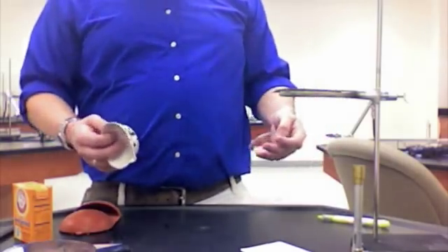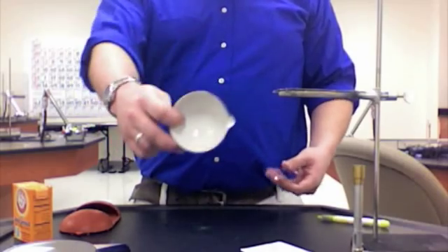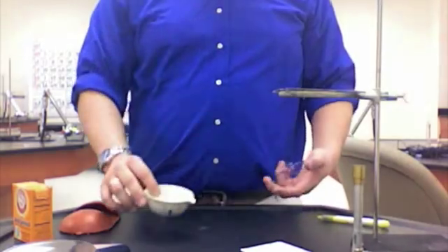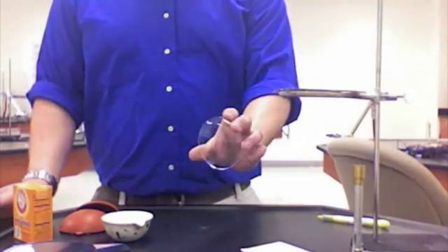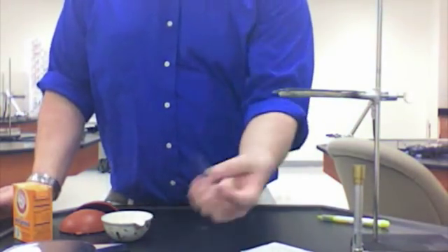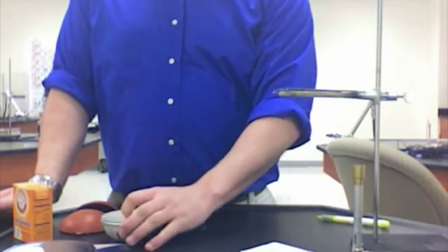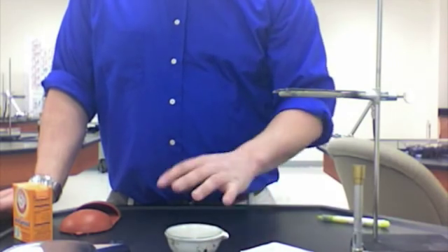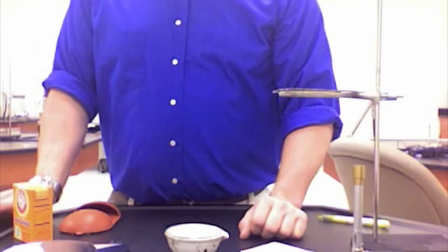Some other things that we need for the experiment include an evaporating dish, this one right here. This is what the chemical reaction is going to take place in. We're going to use this big contact lens looking thing called a watch glass as a lid for our evaporating dish. When we heat it, it's going to keep some of the solid sodium acetate from jumping out during the reaction.